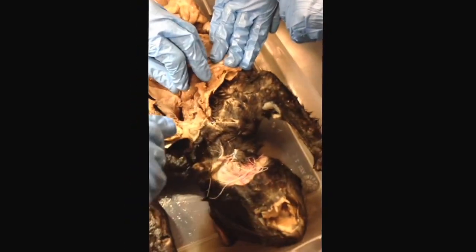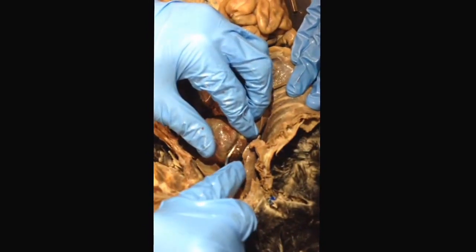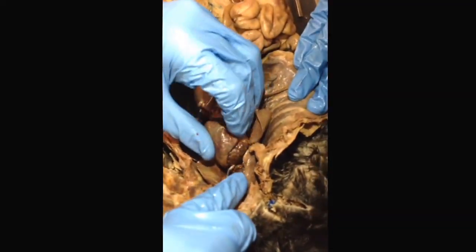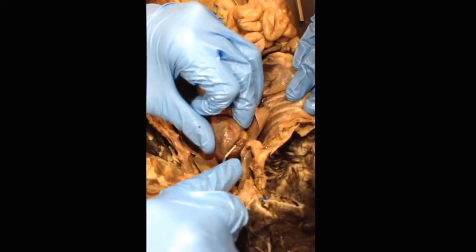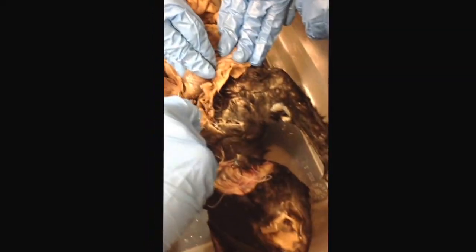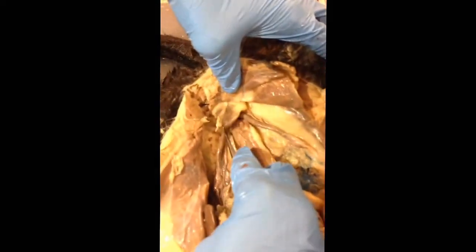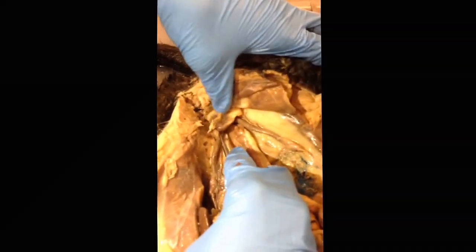Thanks. Next thing is the right auricle, and the auricles are pretty straightforward. The important thing is to look at this from the perspective of the cat. So that will be the right auricle, and the left auricle is the small flap on the other side. The next thing on the list is the urinary bladder. It's pretty straightforward. It's the big flap of tissue. It's an empty sac on the very posterior part of the organism.